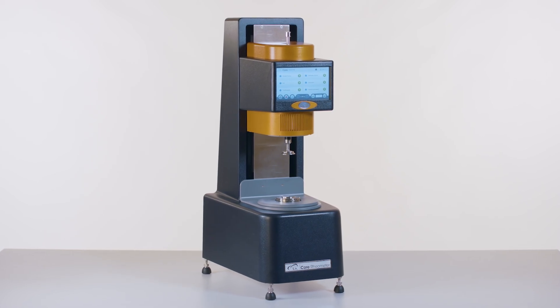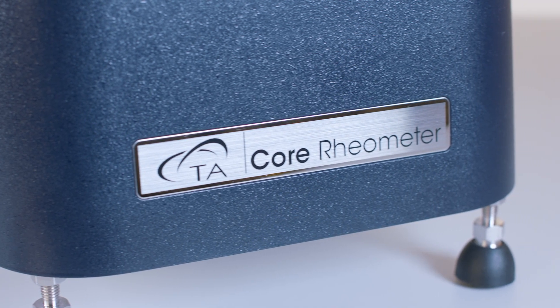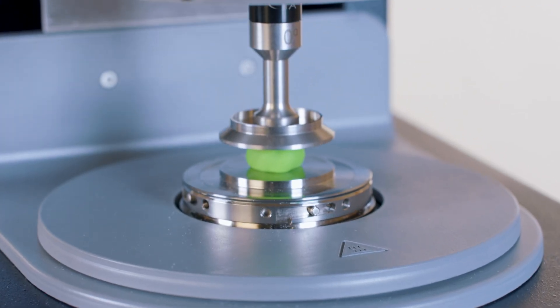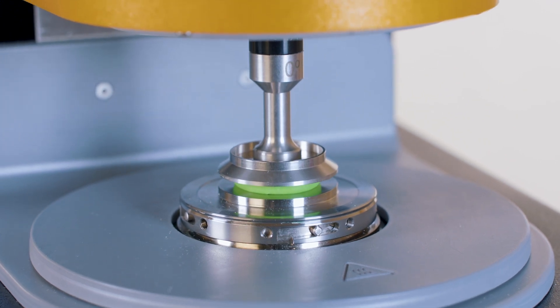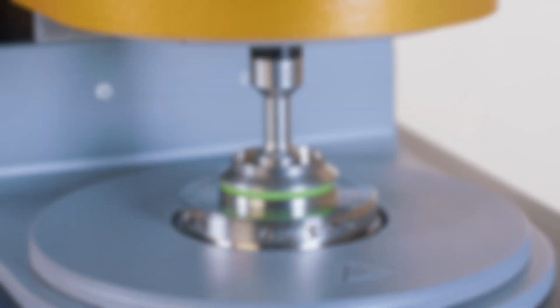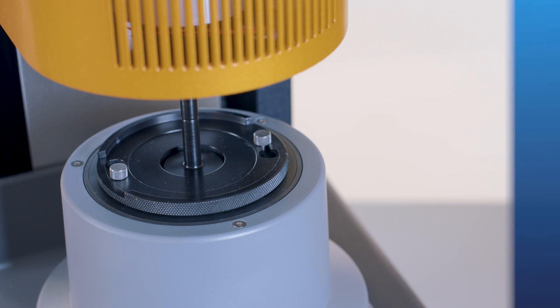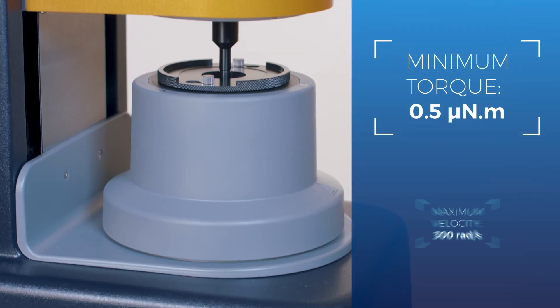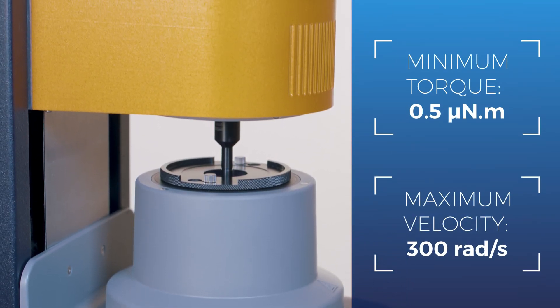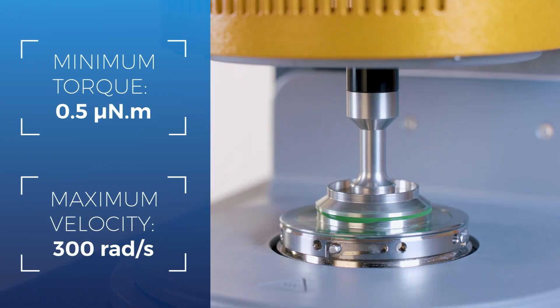To better meet this need, TA Instruments is proud to introduce the Discovery Core Rheometer — an expansion of our industry-leading rheology portfolio with a new accessible rheology solution. The Discovery Core Rheometer provides the exceptional torque sensitivity needed to measure wide ranges of viscosity under process-relevant shear rates.